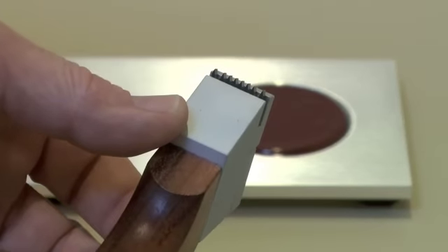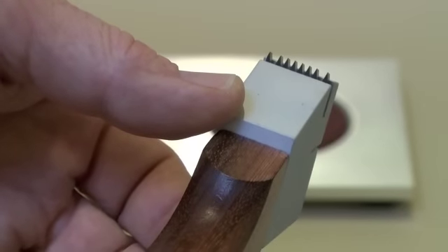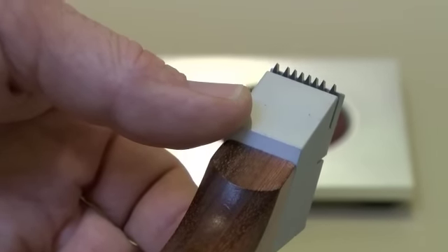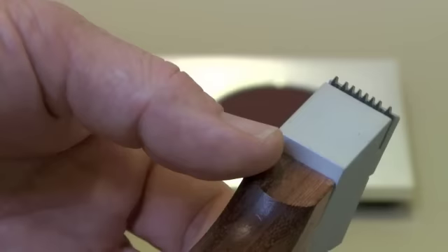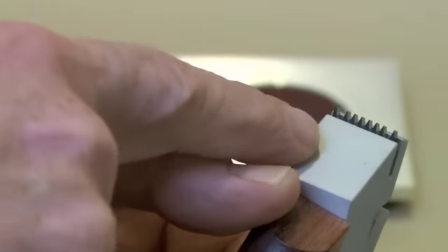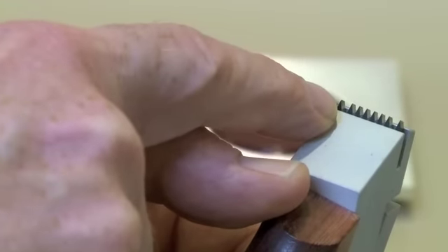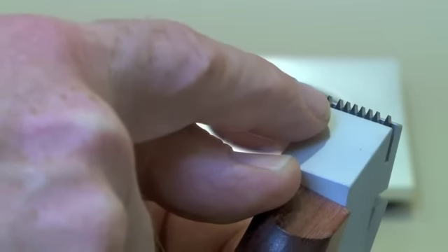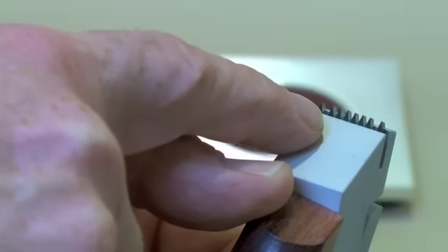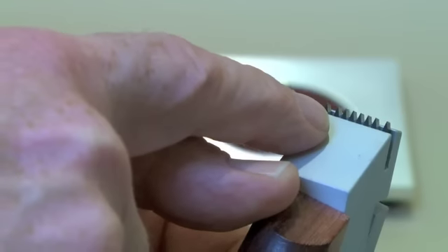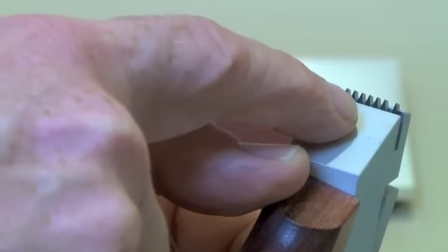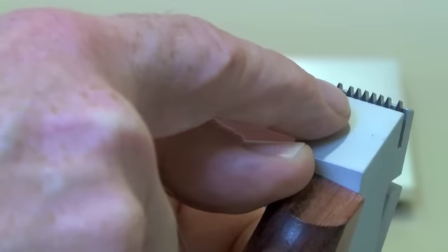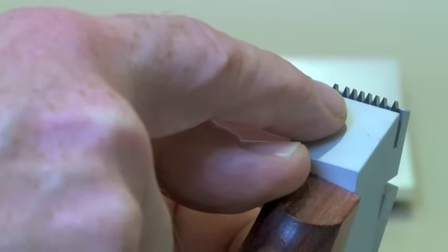As you can see, there are several blades. The end blades on either end are guides to help make sure that you have a good contact with your surface that you are cutting, because the six blades in the middle are doing the actual cutting.